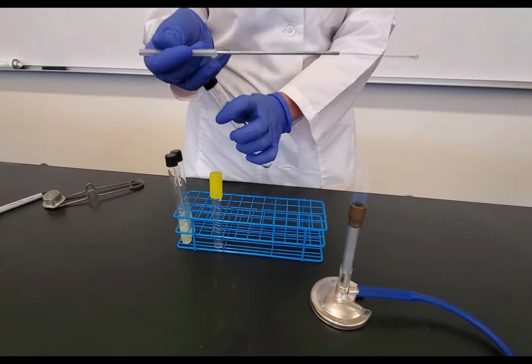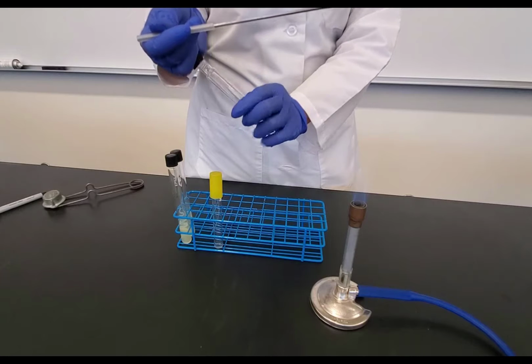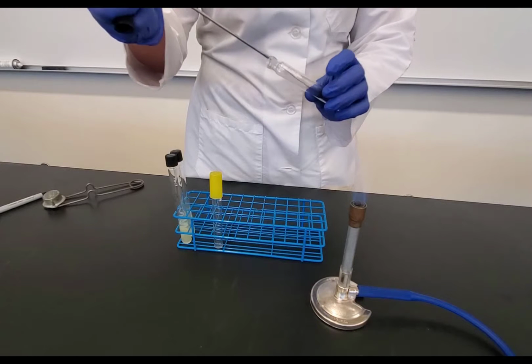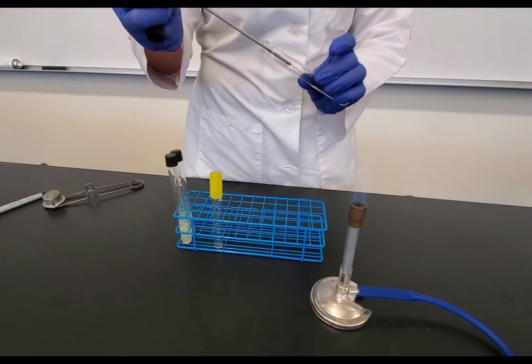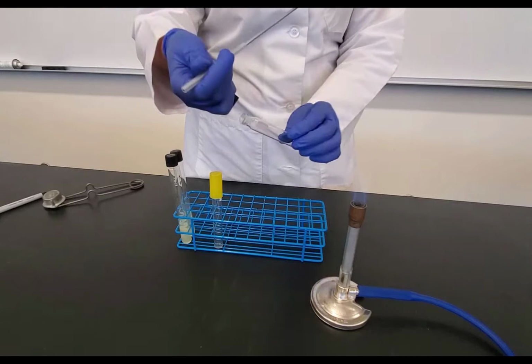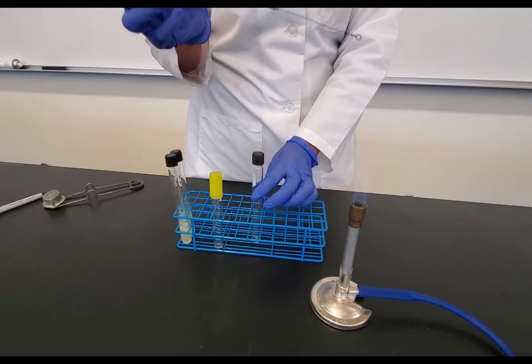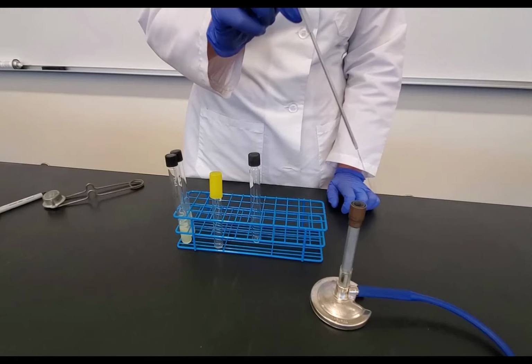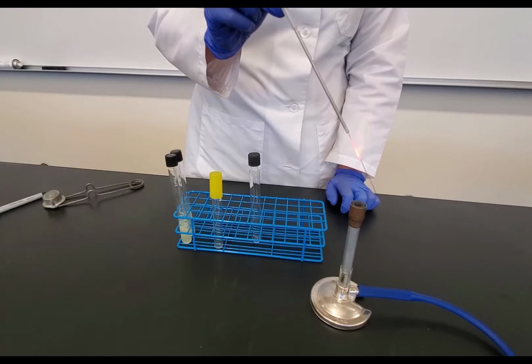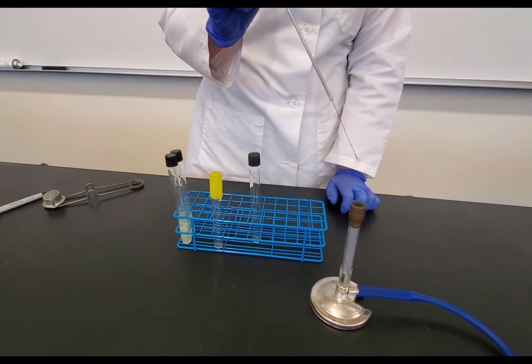Now I'm going to pick up the tube to make the transfer. I put the cap between my pinky and my ring finger. Again, I unscrew it. That was the advantage of unscrewing it first. Flame the opening of the tube. And then I'm going to inoculate that new tube with the bacteria that's on my loop. Bring the loop out, flame the opening of the tube, put the cap back on, and I'm going to set it down. Now, notice that there's still bacteria on my loop, so I need to re-sterilize it by flaming at the base and again working towards the tip of the loop. And once I do that, then I'm ready to set my loop down.